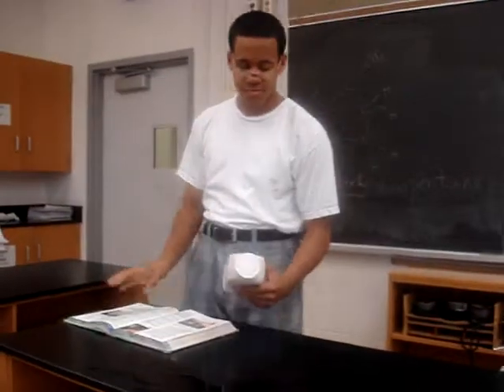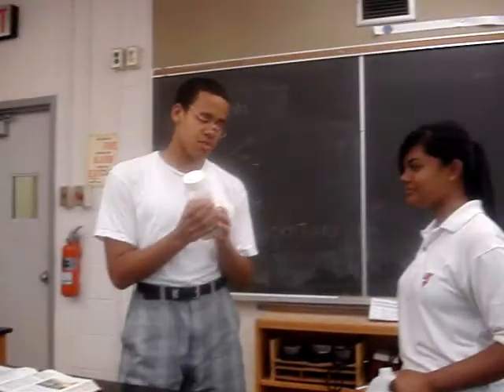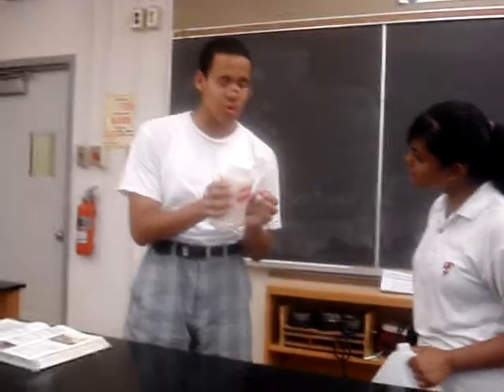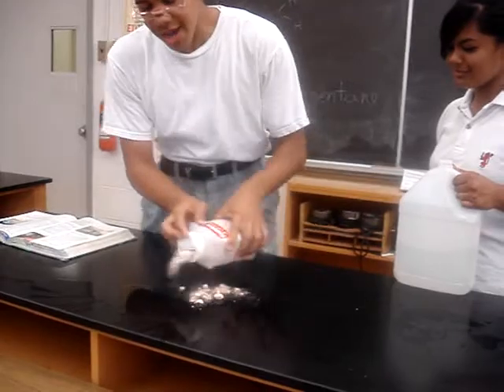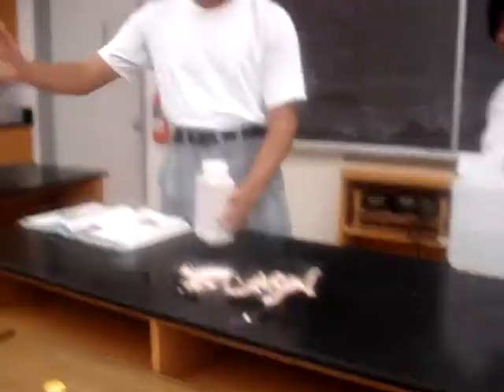Relax. It's an acid neutralizer, so what we do here is really simple. Just take this, just go. Oh my god, it's acid neutralization. Whee!